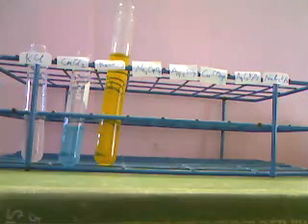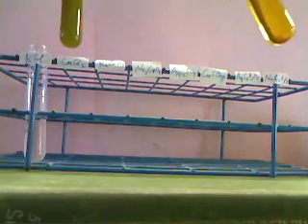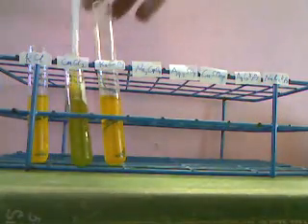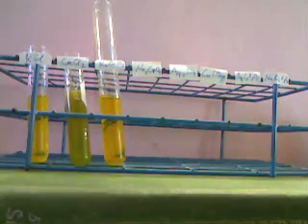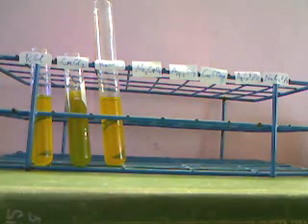Now I have to go down to the next row and combine the solutions in the next row on our table. We'll now combine the potassium chromate with our remaining 2 solutions and see what happens. And there's our result.